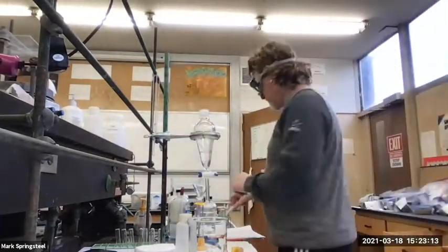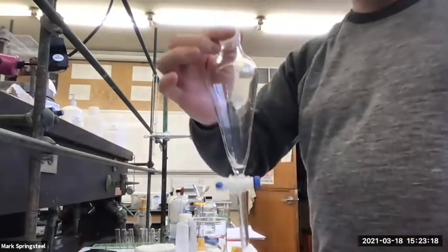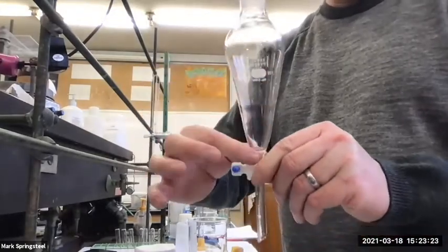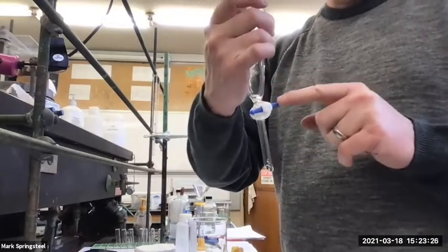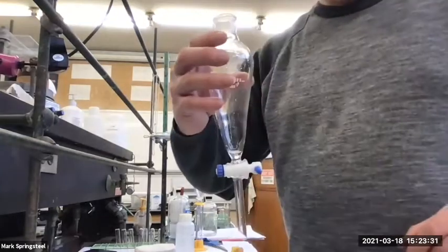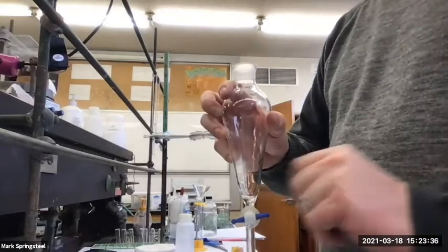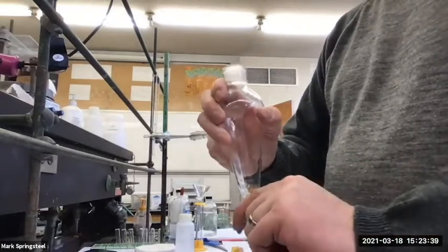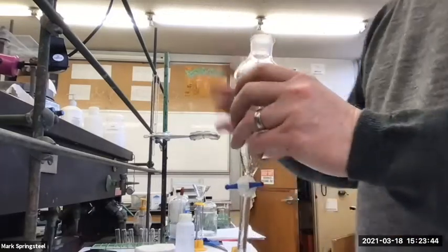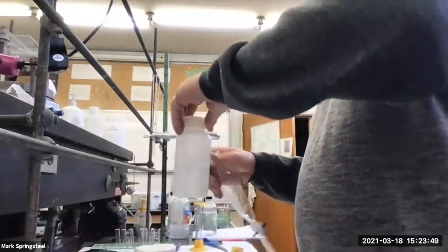Now we're going to go a little larger scale, so the centrifuge tube is not as convenient. Instead, we're going to use what's called a separatory funnel. It's got the opening at the top, and it's kind of a teardrop shape. It's got a stopcock at the bottom, like a buret. You can let water out by twisting the knob vertical. Right now, it's not letting anything out. If I twist it vertical, it's going to drip out. Actually, if this is the first time you've used this for this semester, it's a good idea to test it first. So I'll test it. It's just some water.